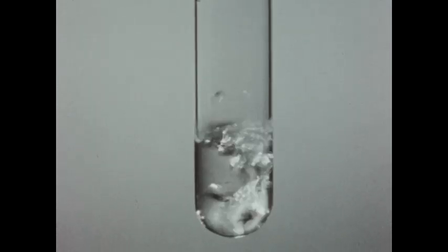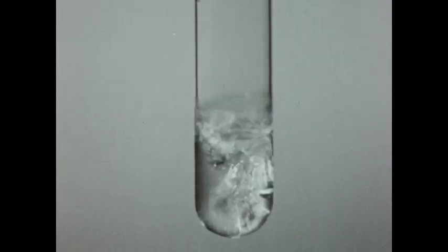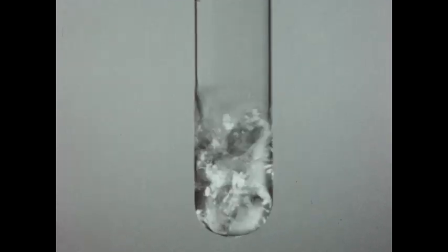We are now examining a sample of pure distilled water, which is boiling in the test tube. We have inserted a thermometer above our boiling distilled water, and you will observe that the distilled water is boiling at 100 degrees centigrade on this thermometer.